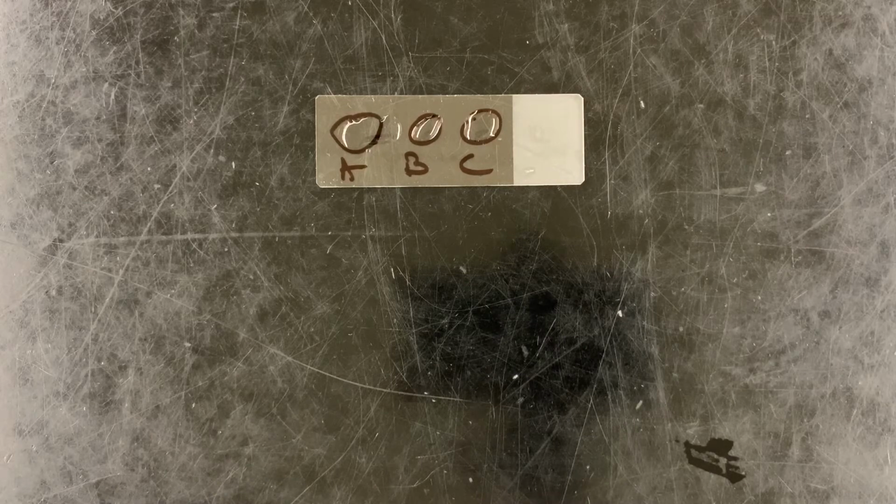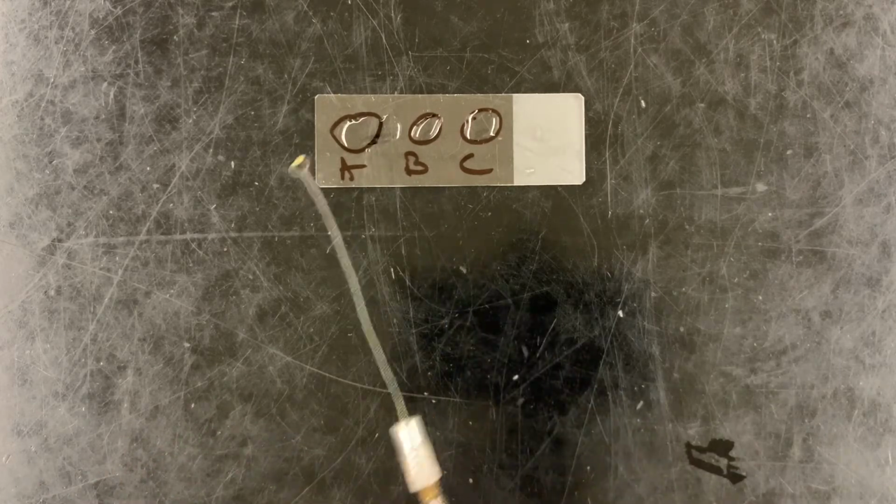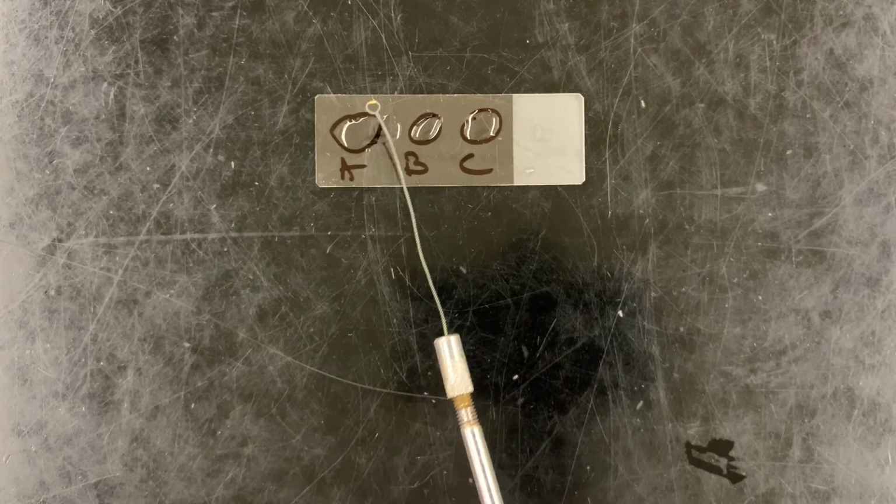So sometimes the microscope stain is a little bit inconclusive, and the way we treat these bacteria is very different. The catalase test helps us because staphylococci, all these bacteria that are circular and grow in clumps, are catalase positive. Streptococci are catalase negative. Here I have my mystery bacterium that may be a staphylococcus, may be a streptococcus. If it's behaving, you should almost instantly be able to tell what type of bacterium this is.